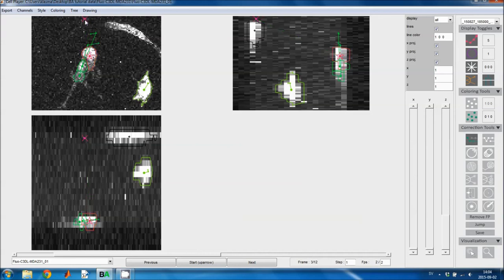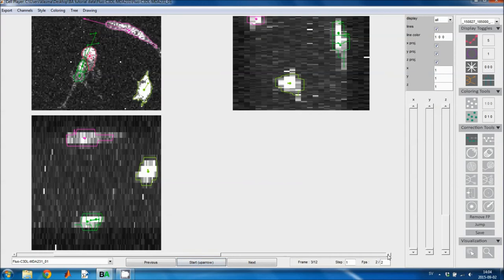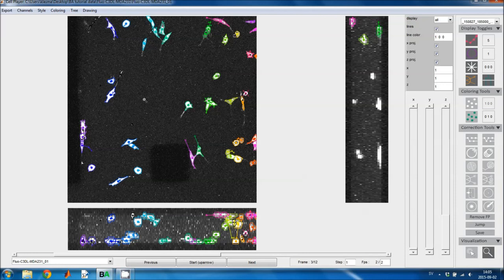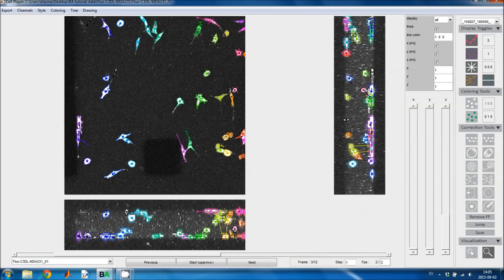So I'll click on it in this view, and you can actually go to the other views and create the link there. In this case it wasn't necessary, but sometimes it's easier to do in a different view. And then I think that this cell here should have been linked to that cell instead, and this one should be removed. And then I can go back in the zoom by double clicking, and I only go back in one view if I double click in it, so I need to double click in all views, or in two views, to zoom out fully. Here's another link that had to be made.